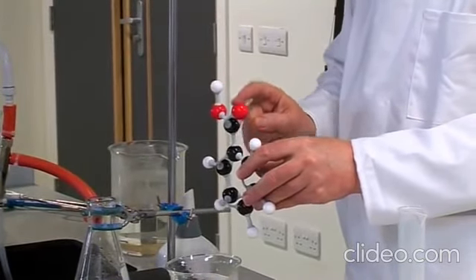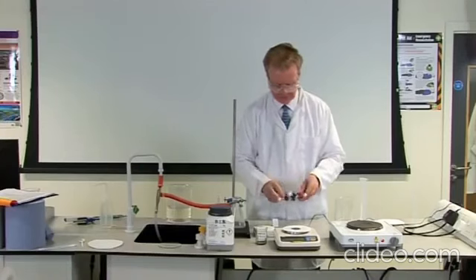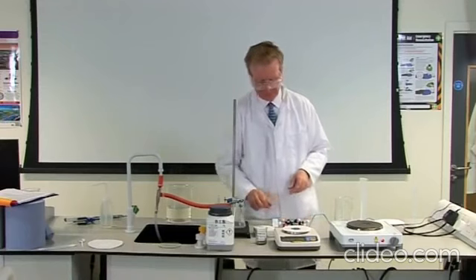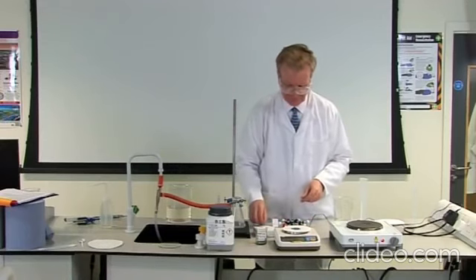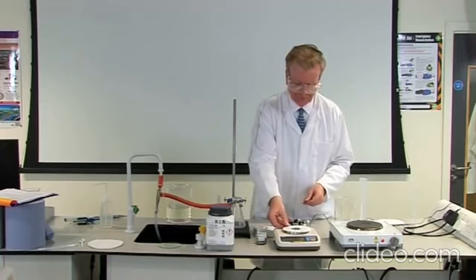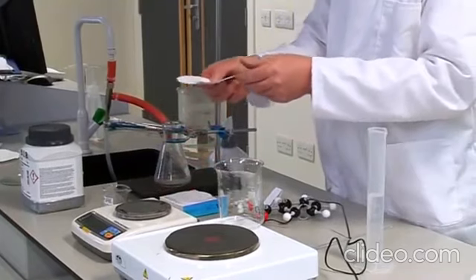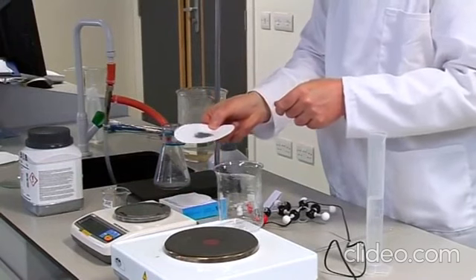C6H5COOH. The process of recrystallization is the most common method used to separate a solid material from solid impurities. The term recrystallization is used because we are starting off with the crystalline material, removing the impurities and making new crystals. The sample of benzoic acid you see here is contaminated with charcoal.